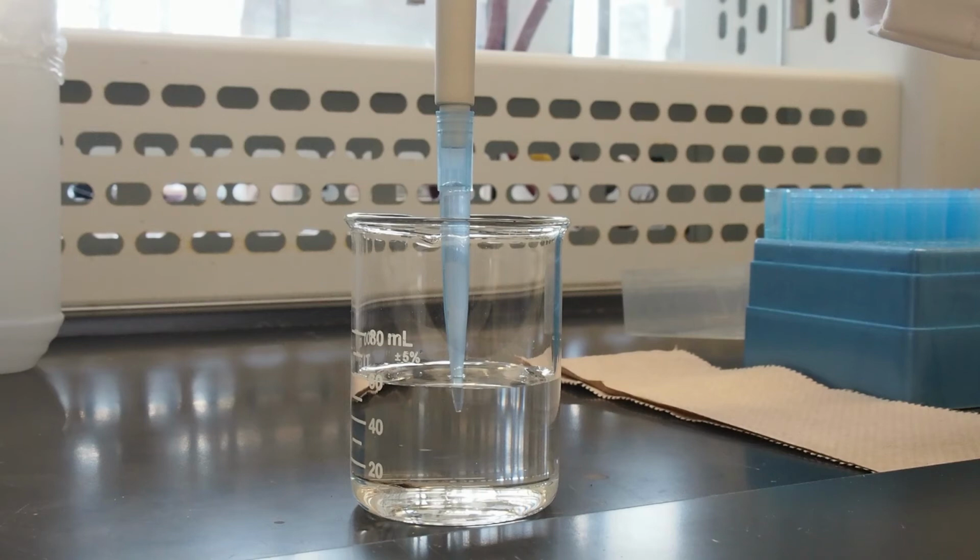It is also very important at this stage to not lay the pipette down while the liquid is in the tip, as this will allow the liquid to enter the barrel. If you do draw liquid into the pipette barrel, alert your TA or technician and obtain another pipette, as it will have to be cleaned, dried, and verified before reuse.